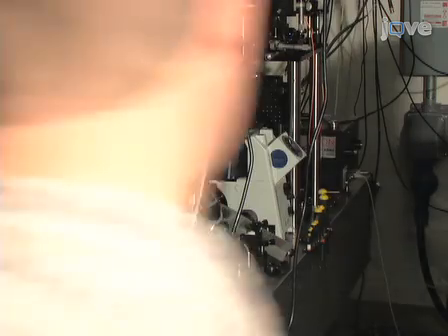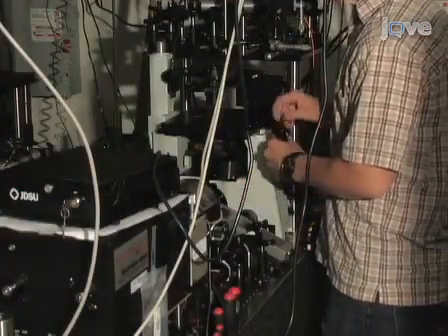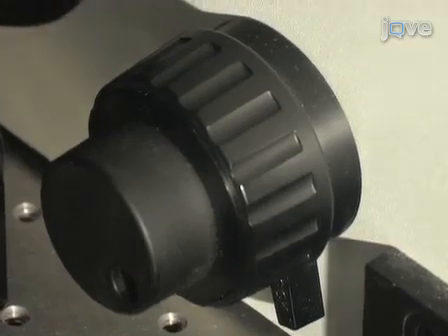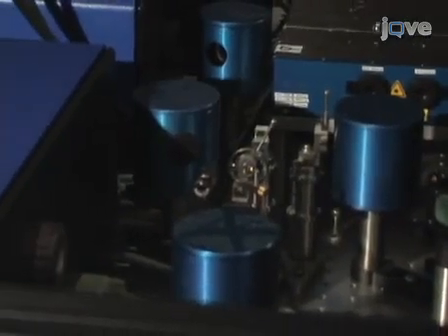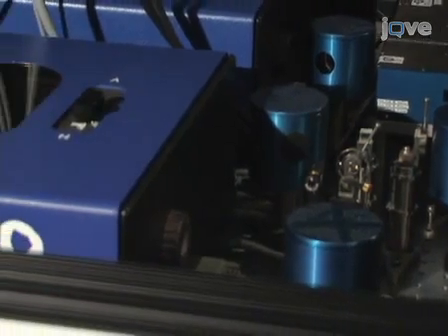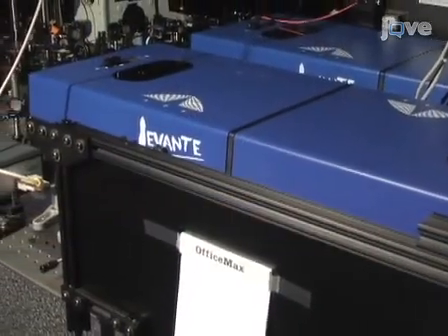The combined laser beams are then coupled into an inverted microscope with an objective lens with high numerical aperture, or NA. The tight focusing, generated by the high NA objective lens, allows for the most efficient generation of coherent Raman signals on microscopic length scales. The objective lens of the microscope is mounted on an XYZ piezo stage, which allows images to be obtained by raster scanning the beams across the sample, similar to commercial beam scanning confocal microscopes. Now let's see how to generate CARS and DR-FWM signals.